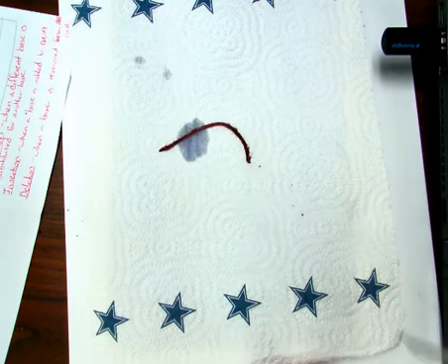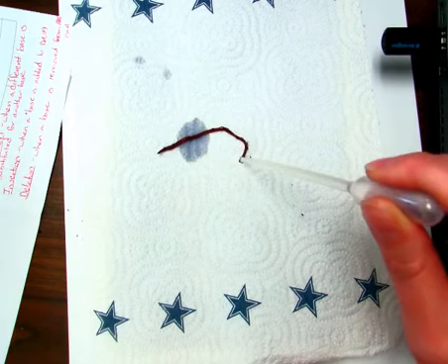Now we're going to drop it here on his posterior end.